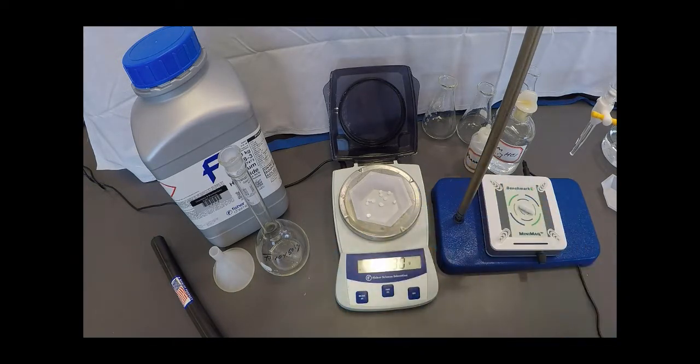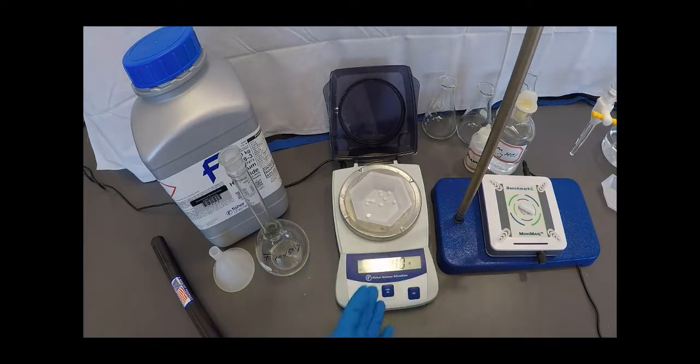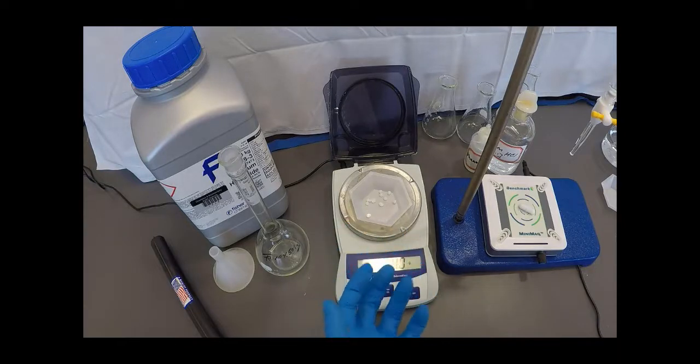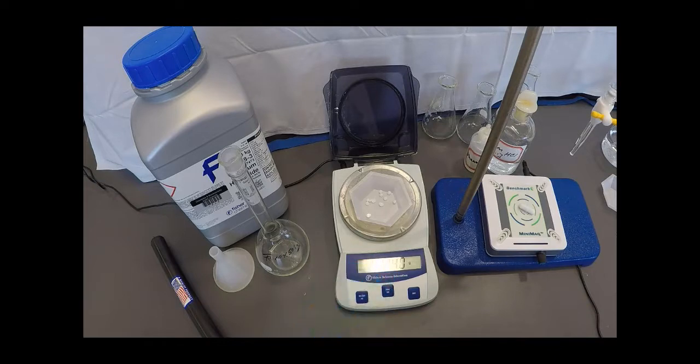For one, they're in pellets so I can't get as granular a measurement as I would like. I can't exactly weigh 1.000 grams of sodium hydroxide. Additionally, the balance is going to continuously drift upward but it's not the balance drifting, it's actually the sodium hydroxide gaining mass from the atmospheric moisture.